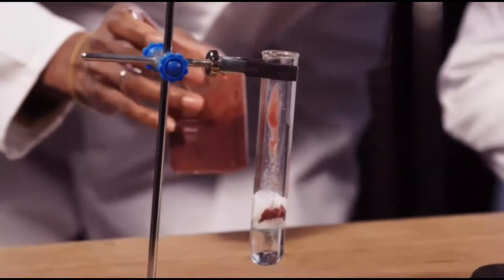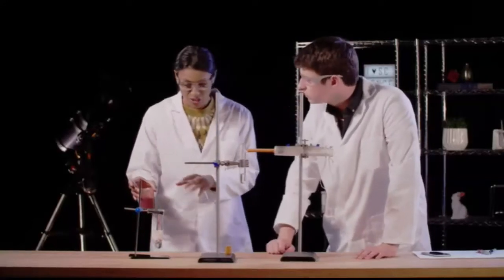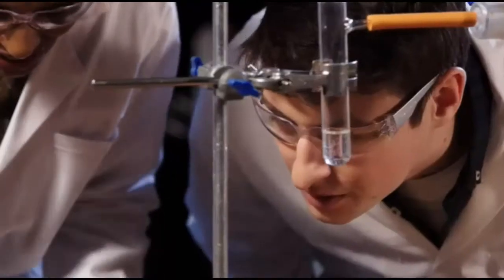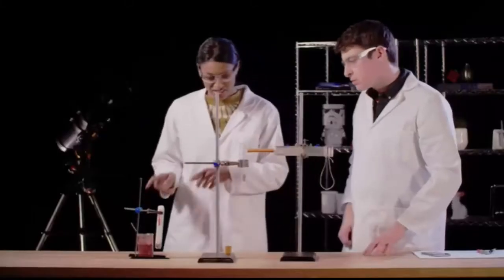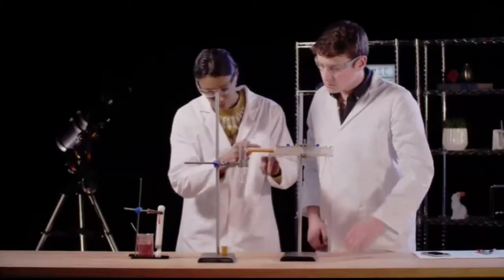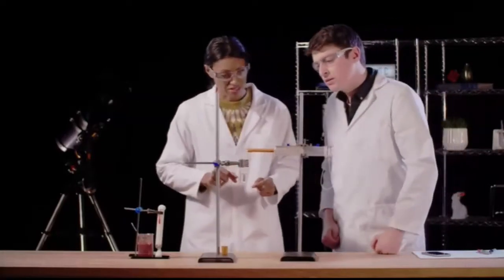Oh, wow. Now, this sludge contains the natural enzyme catalase, which is very similar in effect to the catalyst that we used, potassium iodide, in the previous demonstration. So you can see it happening, but how are you going to measure the rate of reaction? Okay, good question. So I'm going to add the sludge to this test tube of hydrogen peroxide, and I'm going to stick the bung on top, and the gas that's generated is going to push down and hopefully push the syringe, and you'll be able to measure the quantity of gas using this cubic centimetre scale.